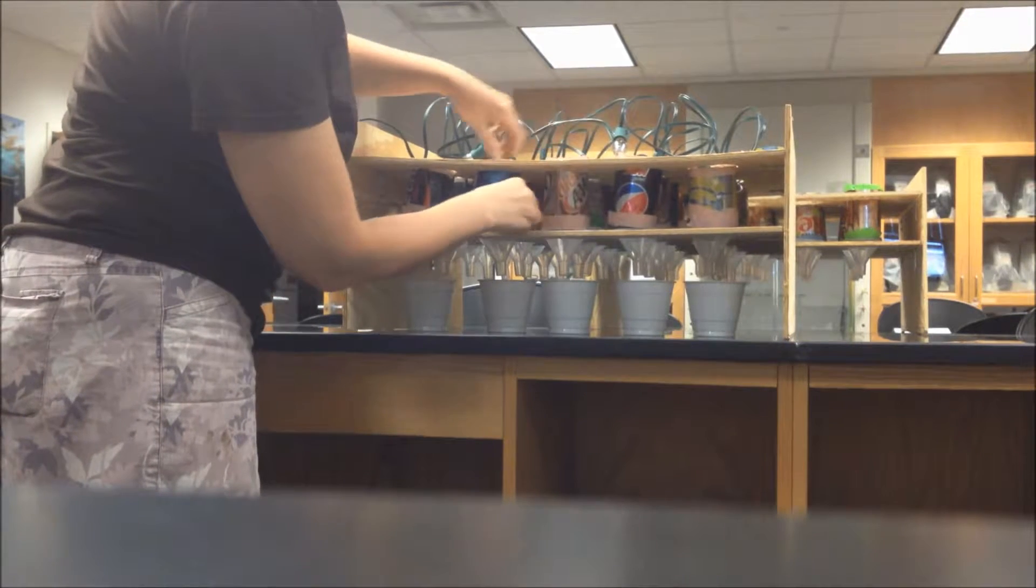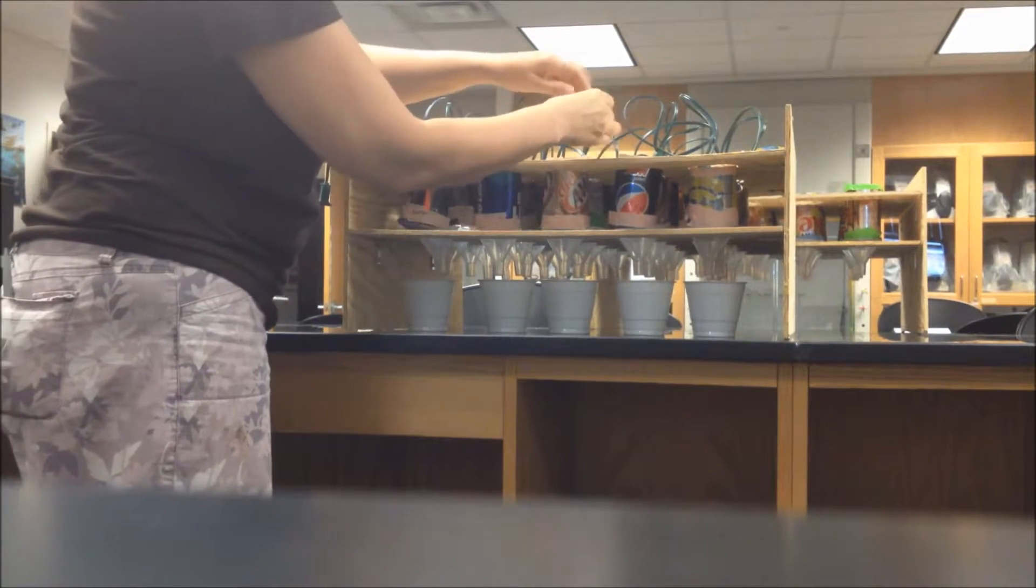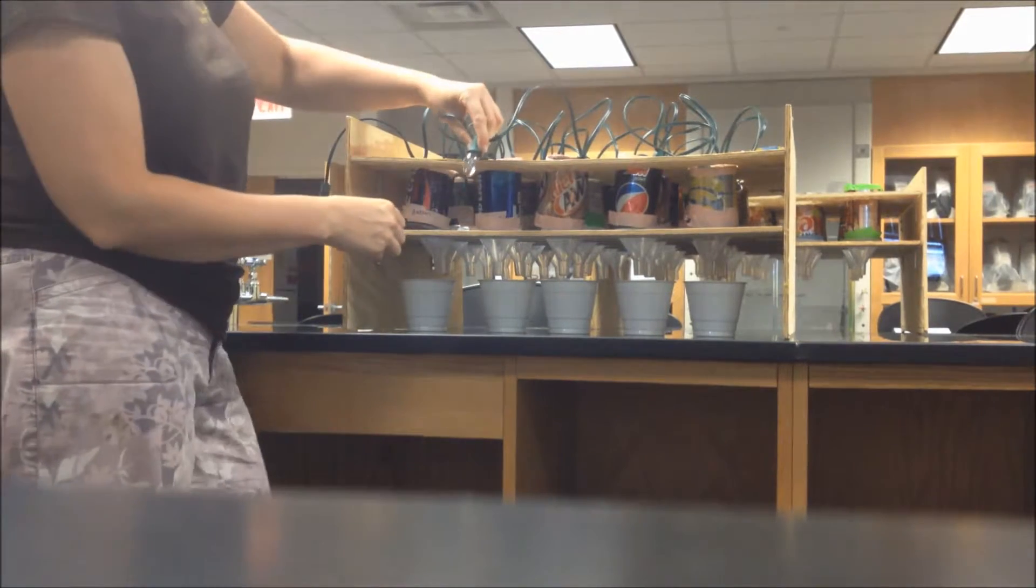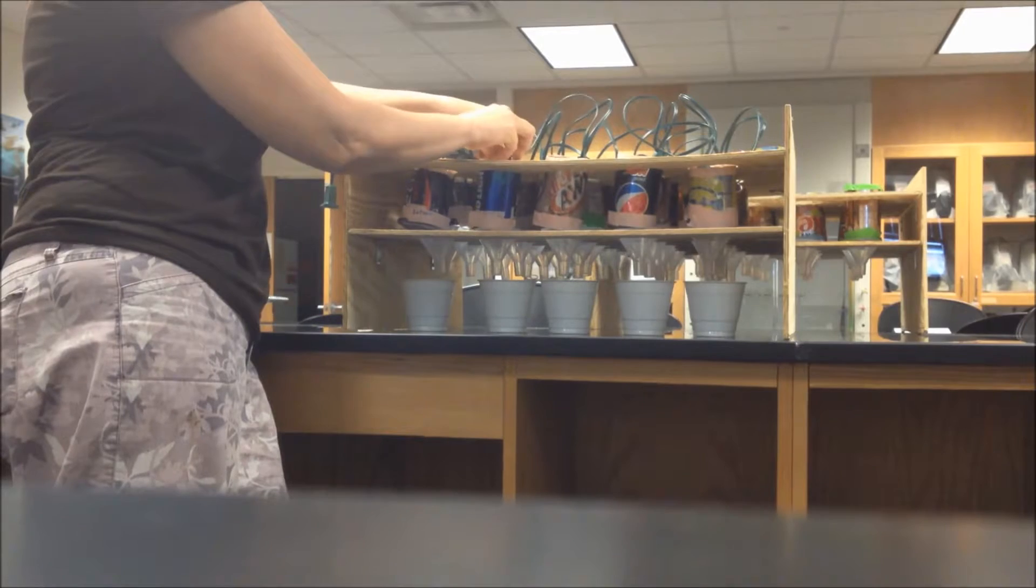Those slide right into the holes and you clip the Christmas lights right on top to the top edge of the can. Remember to use incandescent Christmas lights; the LED ones won't produce heat.